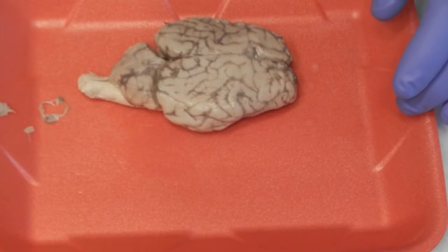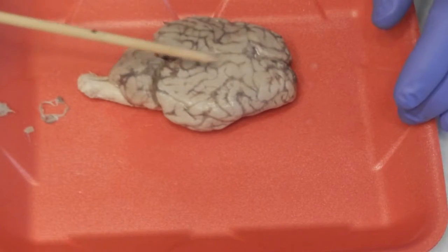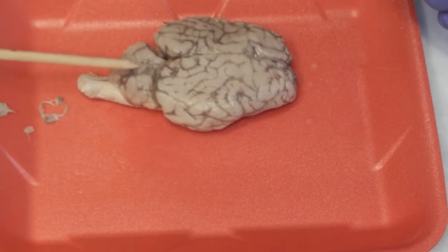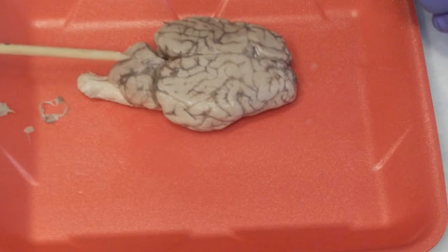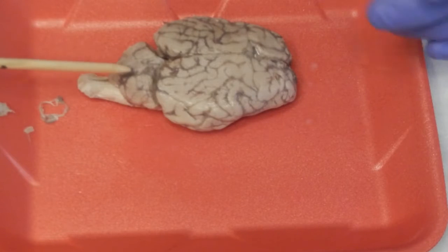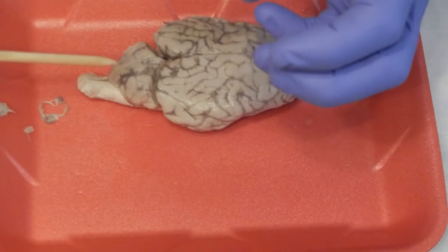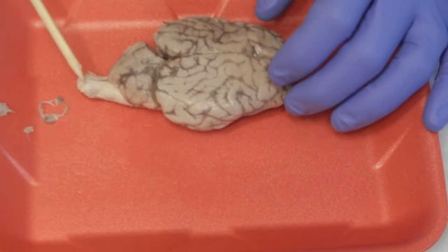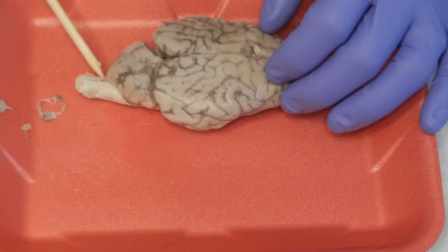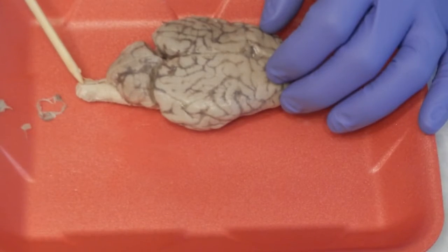This being the cerebrum and the cerebellum. Of course, the cerebrum is the largest portion of the brain, and the cerebellum is the smallest portion of the brain. It's also been called the mini brain or the small brain. And the cerebellum, of course, is responsible for fine motor coordination, being able to tactfully do fine motor movements. So what we have here also is the furthest end of the medulla as well as the spinal cord here.